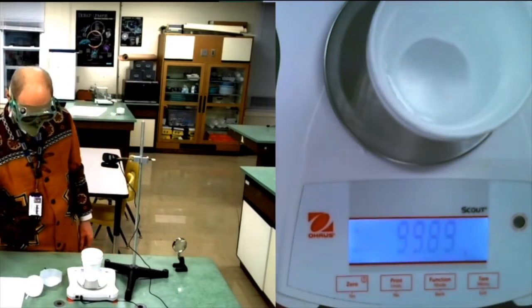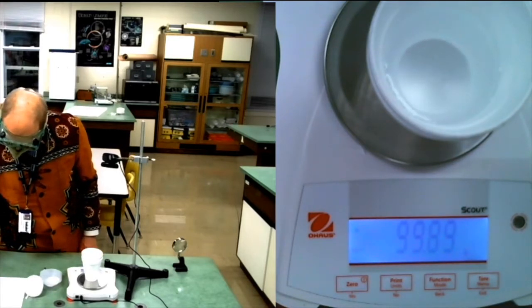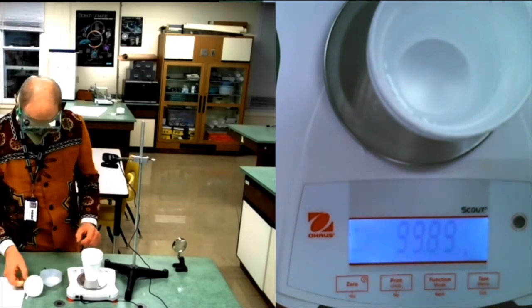That's pretty close, 99.89 grams of water. Now to find its temperature.